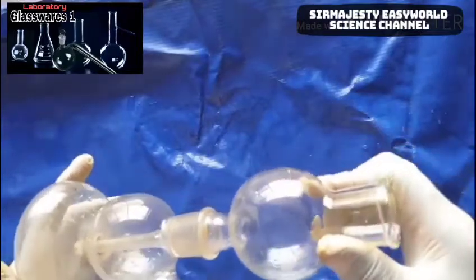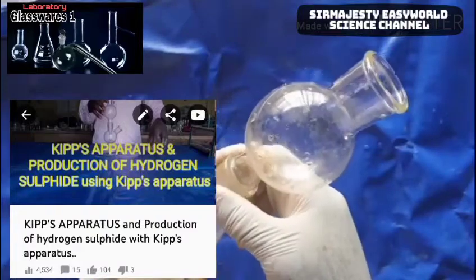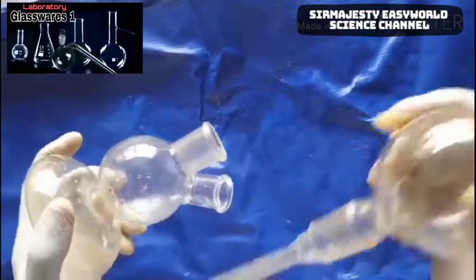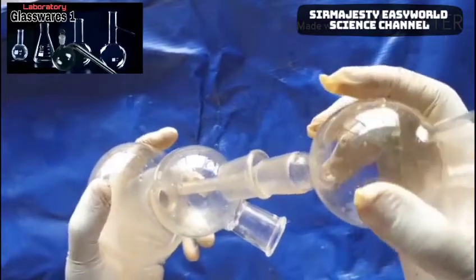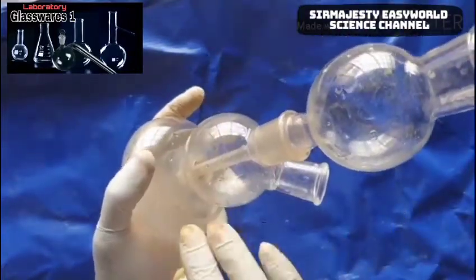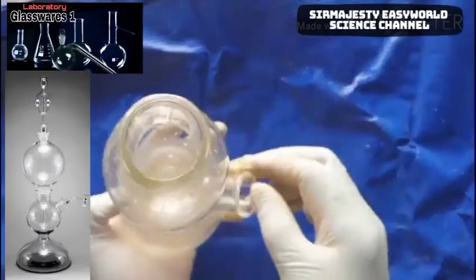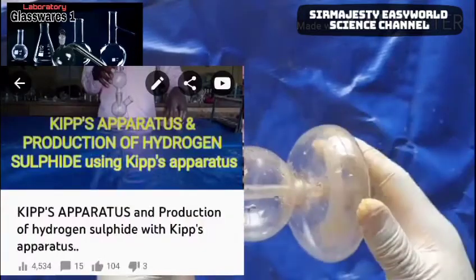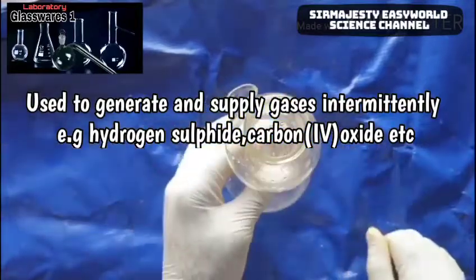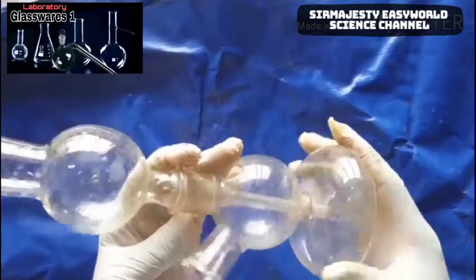This is called Kipp's apparatus. I've used this in one of my videos to manufacture hydrogen sulfide — the gas with a rotten egg smell. Watch that video to understand more. Kipp's apparatus is commonly used for the intermittent supply of gases in the lab. It has three chambers: A, B, and C. The liquid reactants are placed in C and A, and the solid is in B. In the middle is where you connect the tube for gas collection.